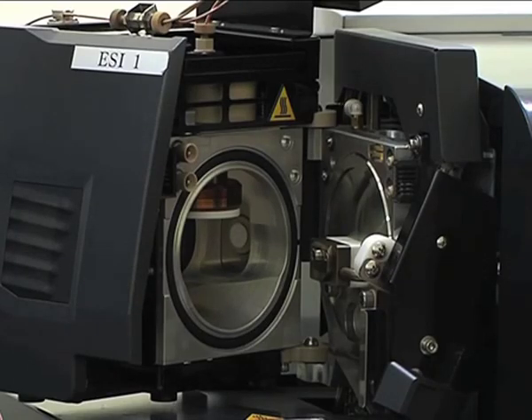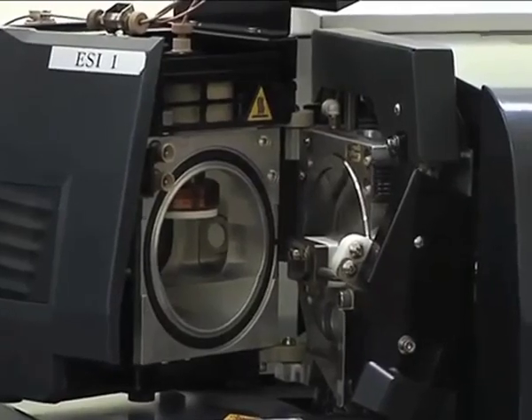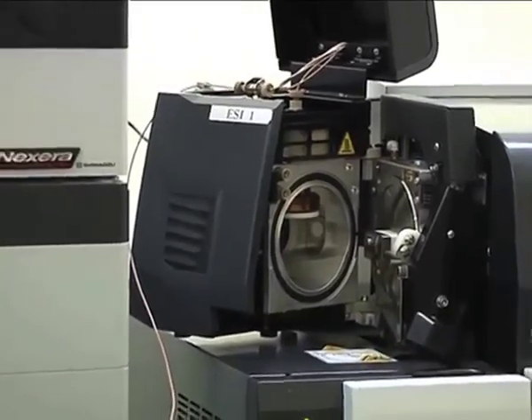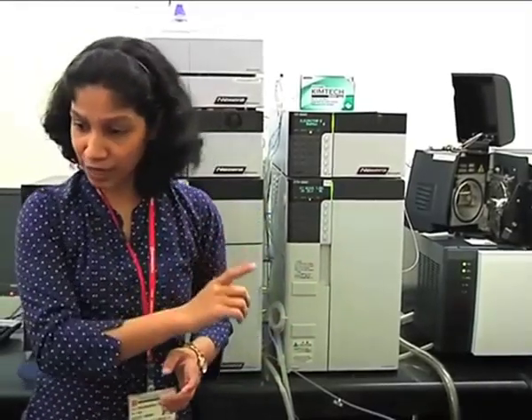What will happen? Whatever charges are present on the droplet will start coming closer and closer. And all those charges are the same charge, positive or negative. So slowly the repulsive forces will increase. One point will come, which is called the Rayleigh limit, where repulsive forces exceed the surface tension force and the droplet cannot hold its size and will burst into smaller droplets. This process will continue till only your analyte containing the charge remains. And this is how ionization takes place in ESI mode.